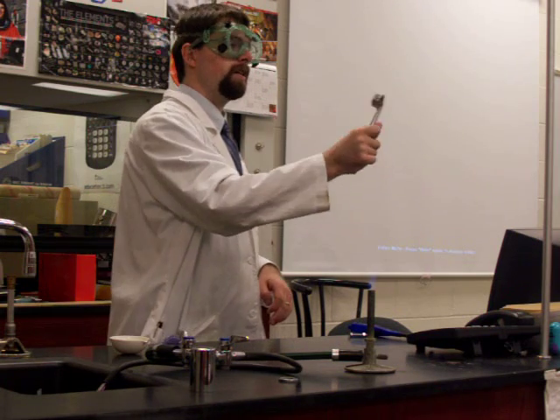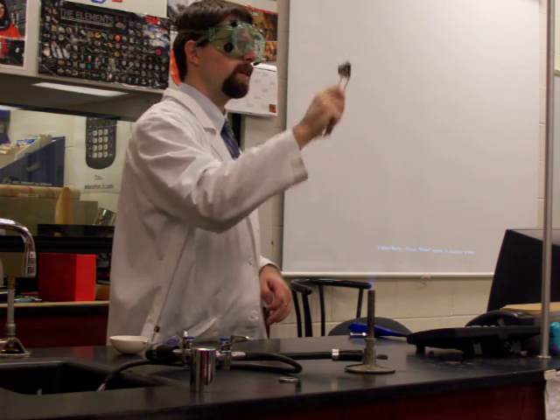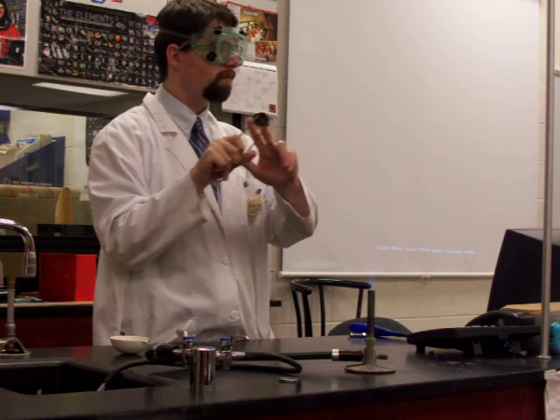Technically you're supposed to push down on one arm and move the other. I usually put my finger there. It's probably not the most advisable to do that, but that's how it's always worked best for me.